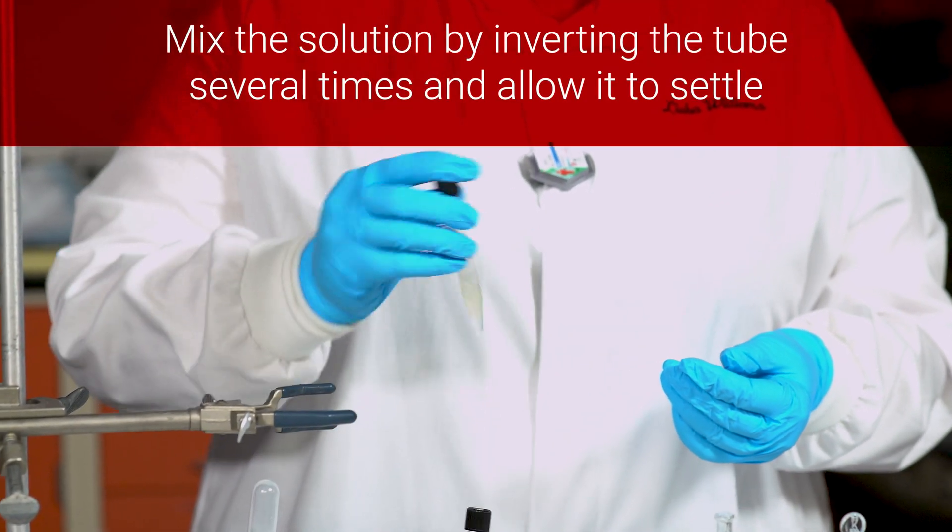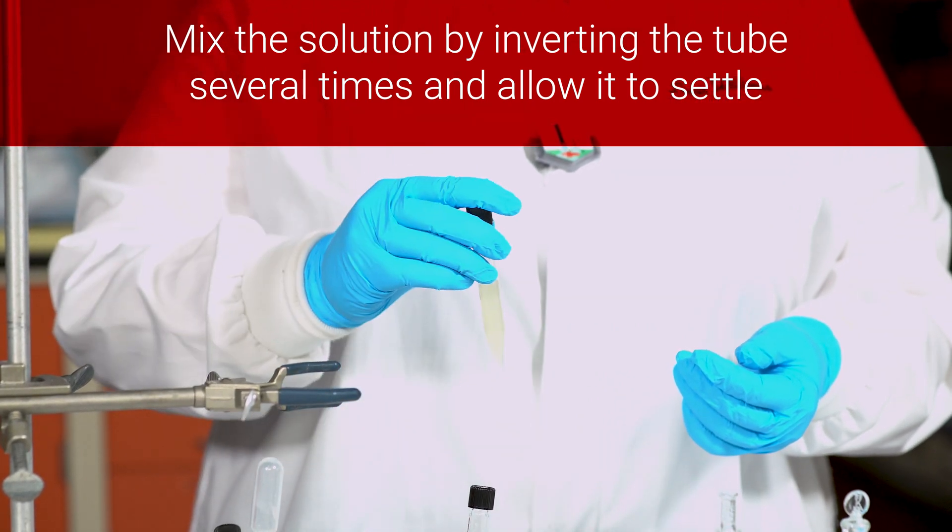Once again, the tube was inverted to mix the solutions and upon settling, the two phases separate completely.